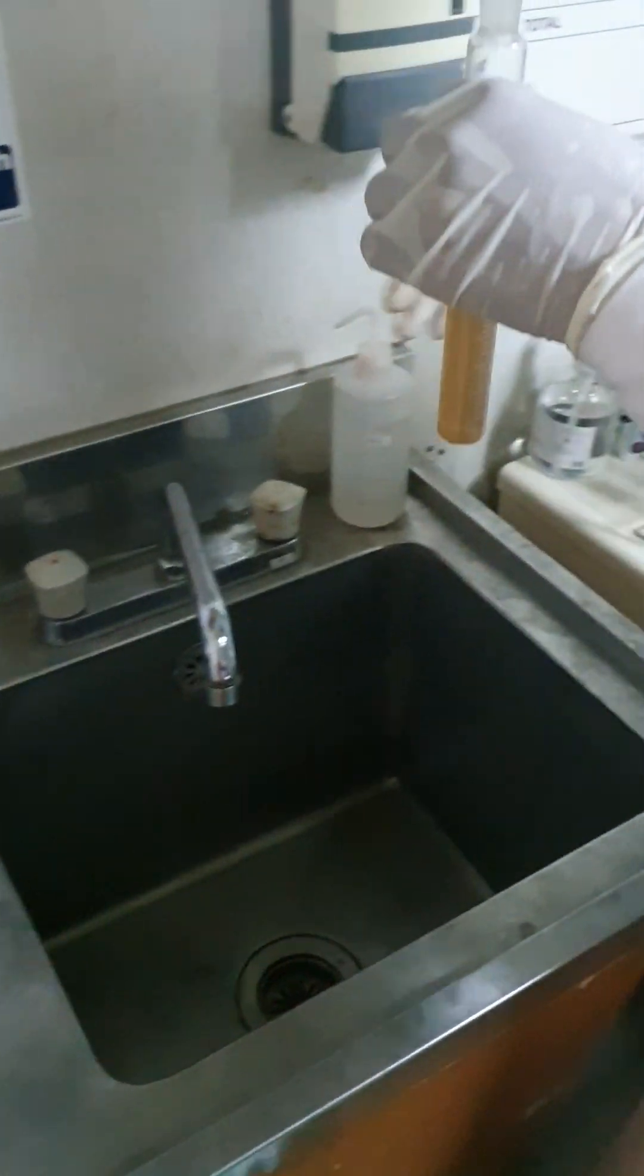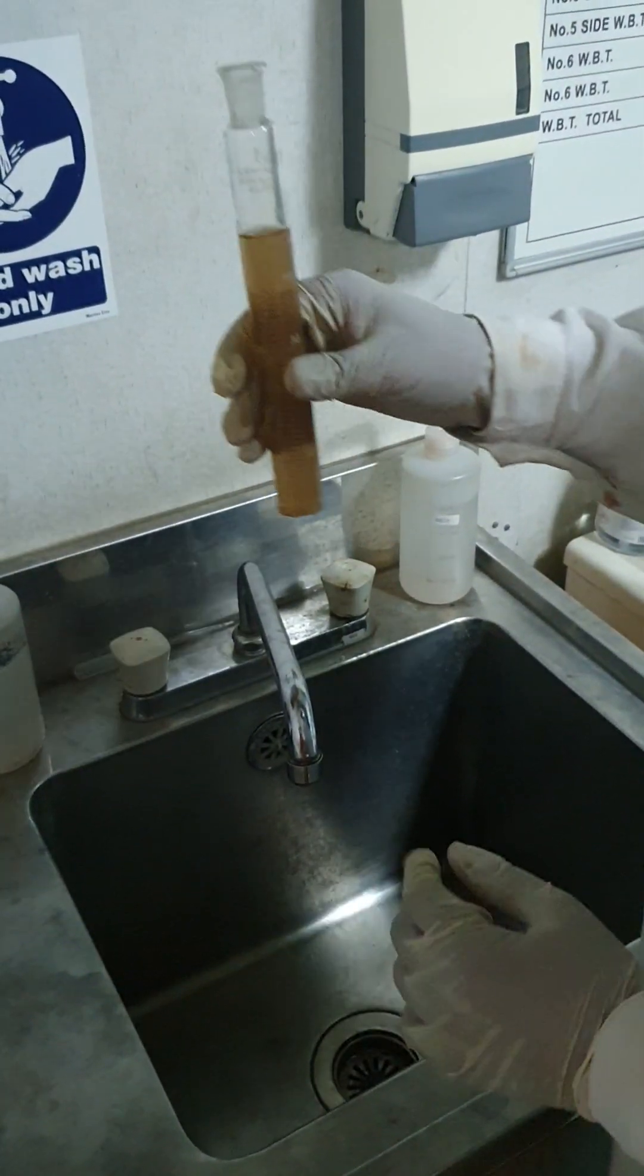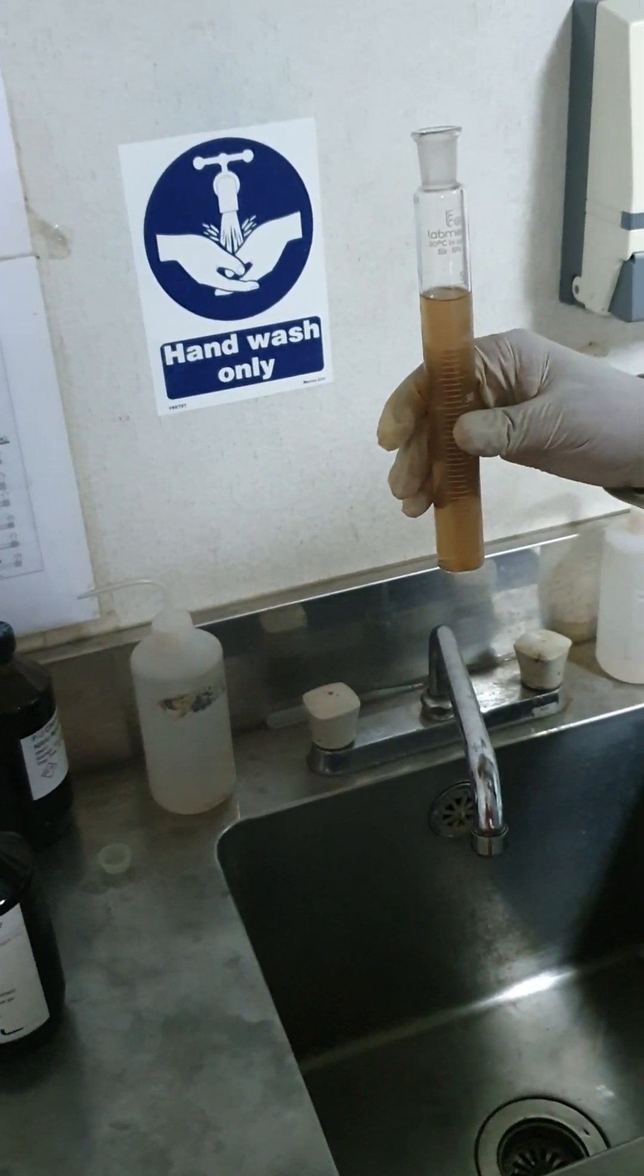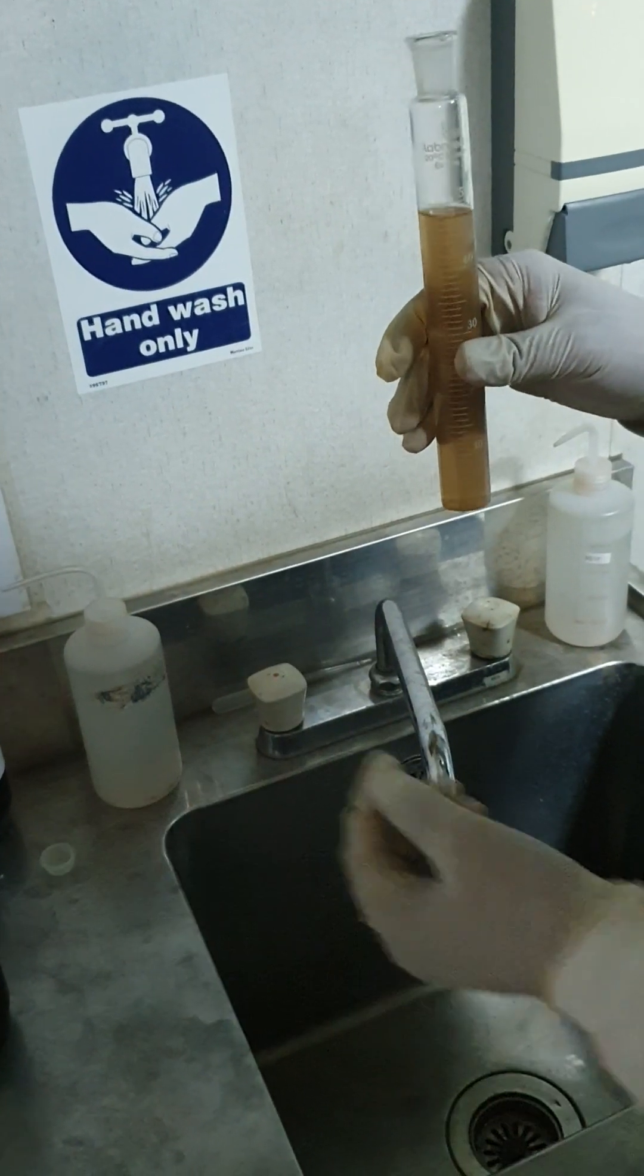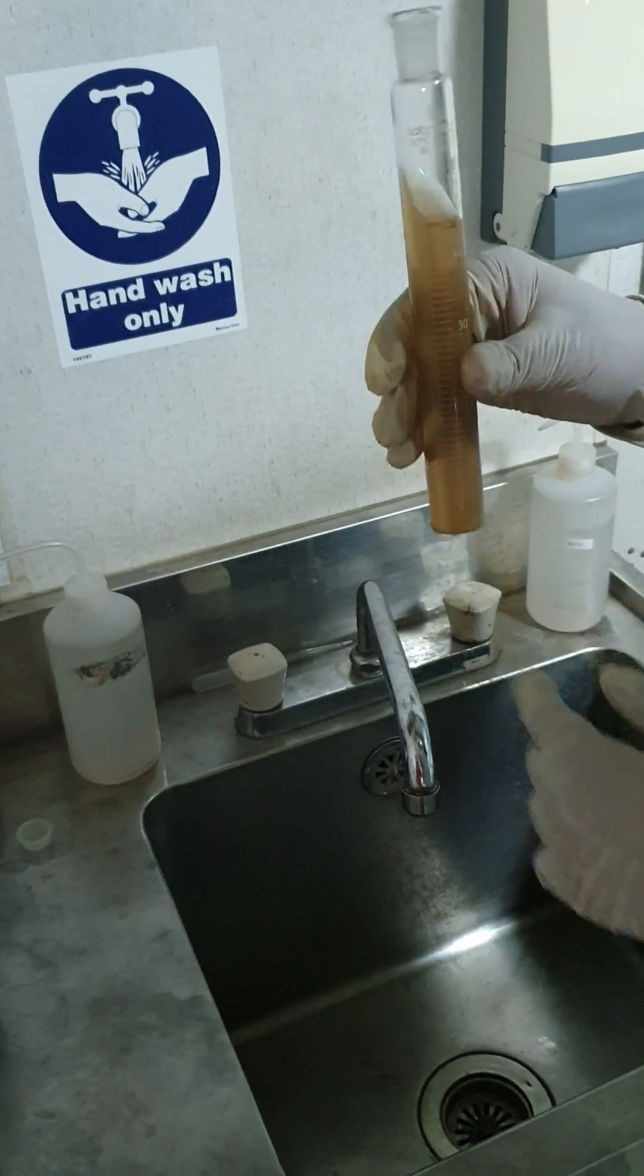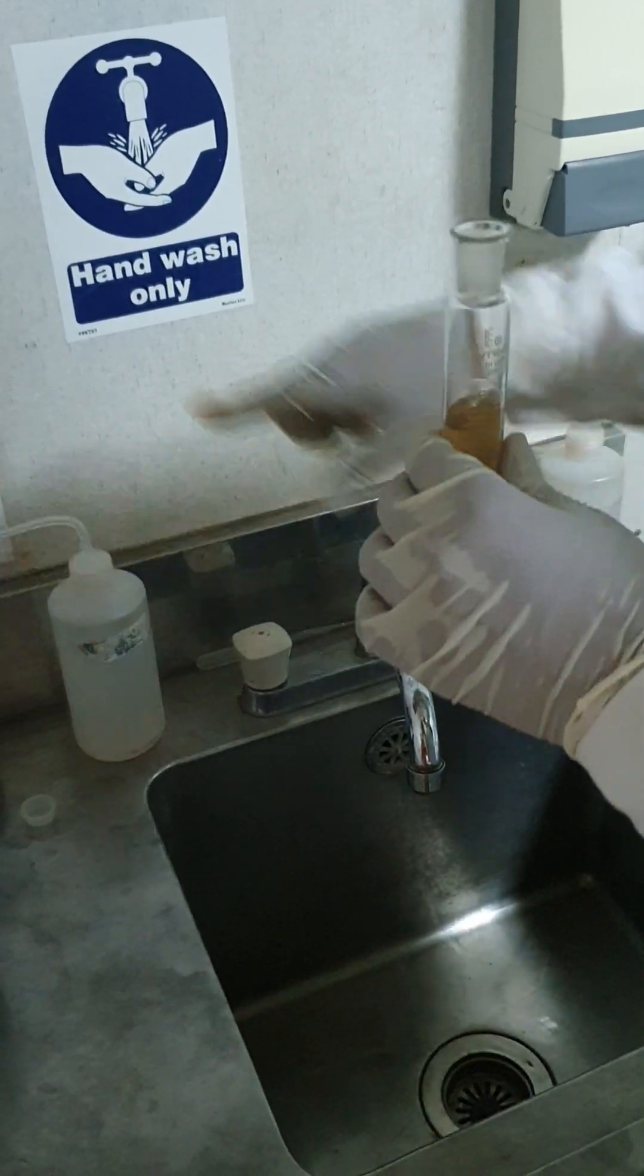For this PTT time test, initially you will use your own potassium permanganate, use the 48cc of the tanks Valor sample. Once you use your original, I mean pure potassium permanganate, this color will come as a red color, near about to the red color, like this.